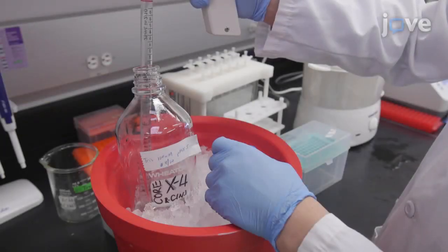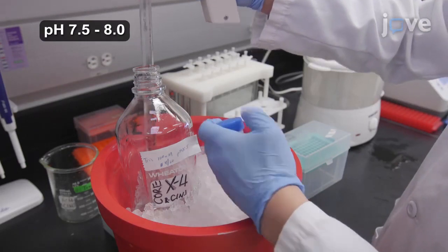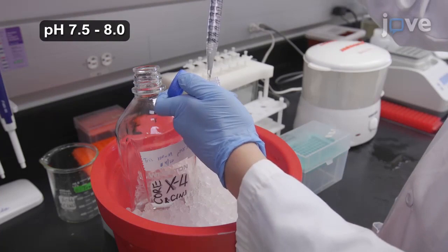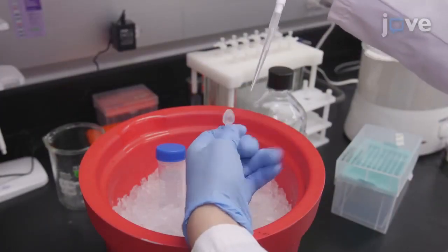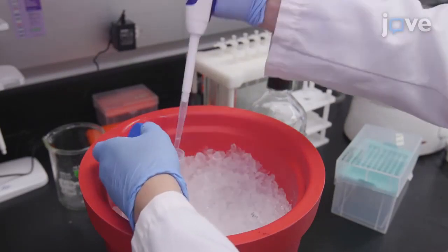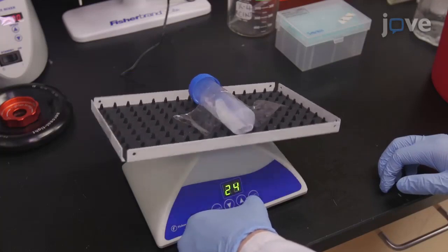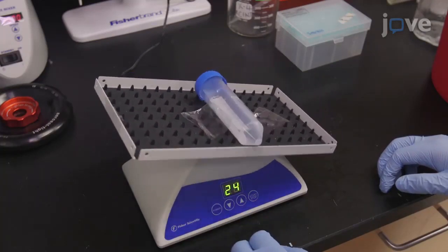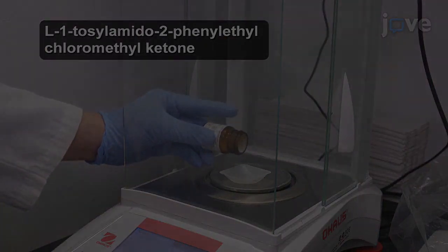To digest the lysate, use 100 millimolar Tris to dilute the sample 12-fold to reduce the amount of guanidinium. For 5 milligrams of protein, add 10 micrograms of lysyl endopeptidase, or Lys-C, and incubate the sample at room temperature for 5 to 6 hours. Prepare 1 milligram per milliliter of TPCK-treated trypsin.